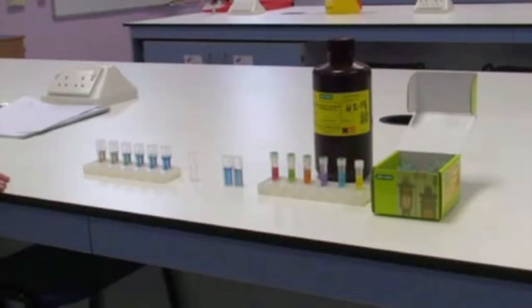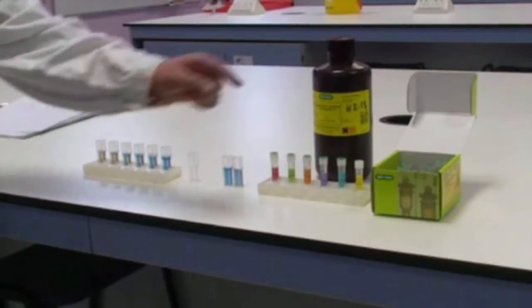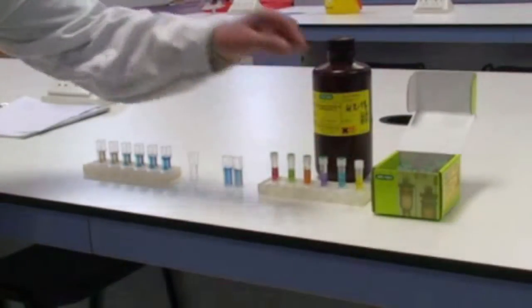You can measure protein concentration using the Bradford Assay. For the Bradford Assay, you will require a range of standards that come ready-made in a box like a kit.